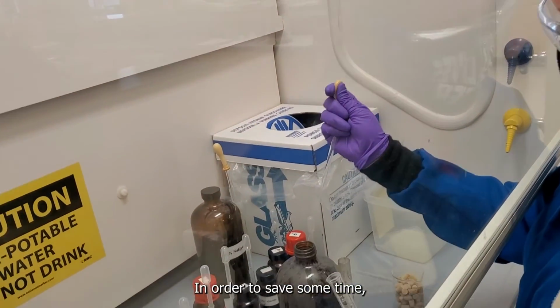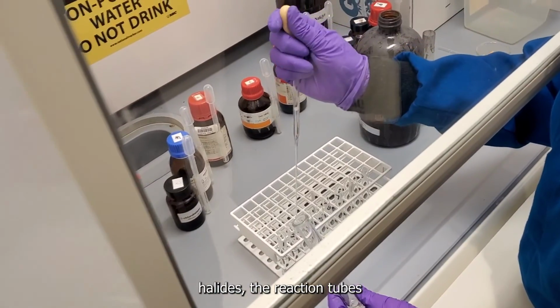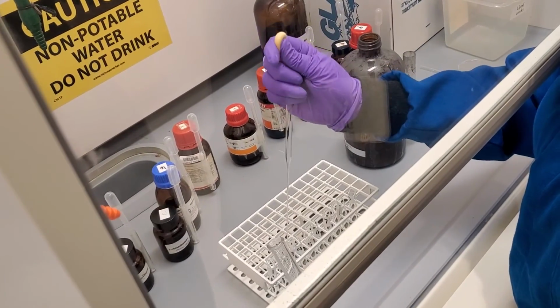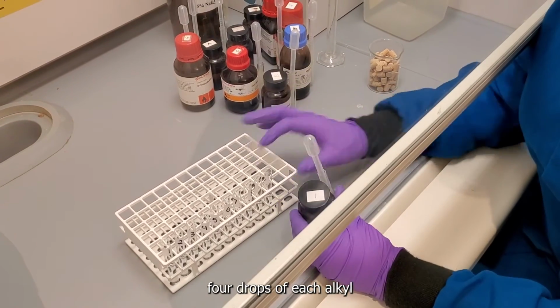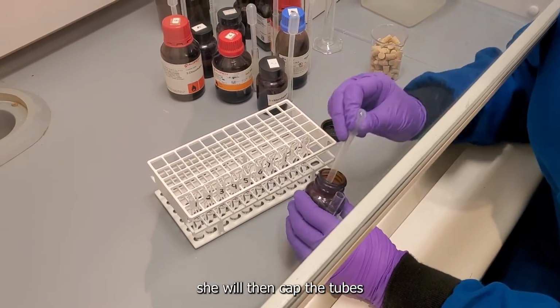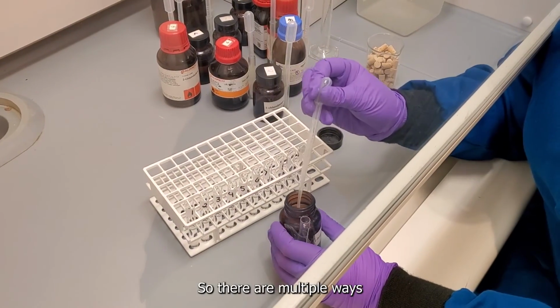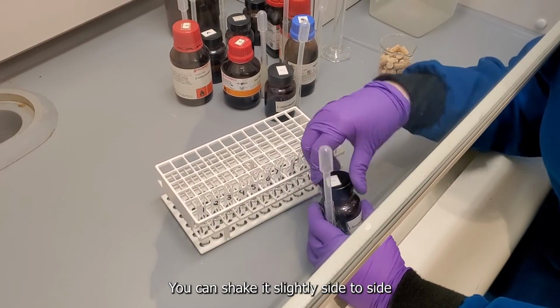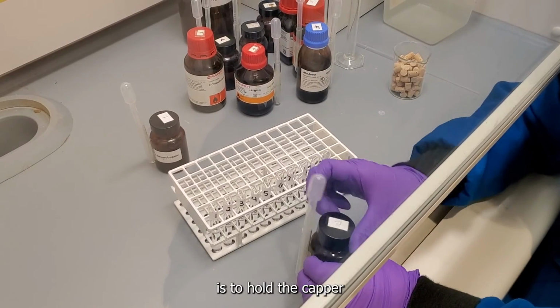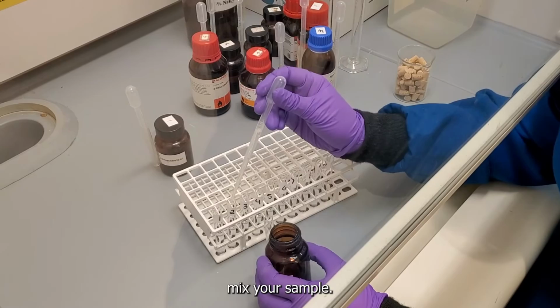In order to save some time, I will cut to the addition of the alkyl halides to the reaction tubes and then show the reactions going forward. So here, Tara is going to be adding 4 drops of each alkyl halide into each tube, and then once finished, she will cap the tubes and give them a slight mix or shake. So there are multiple ways you can do this. You can shake it slightly side to side, or another way to mix them is to hold the cap on the top of the tube and then flick the bottom of the tube to appropriately mix your sample.